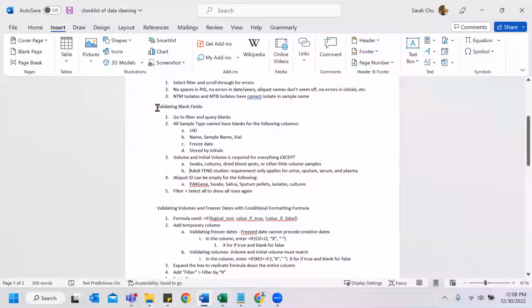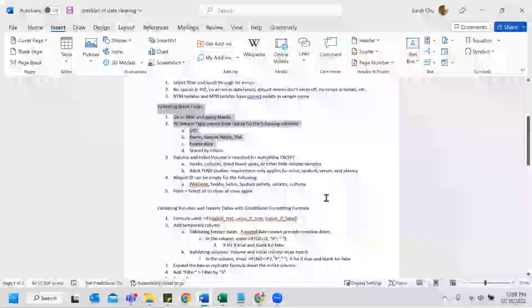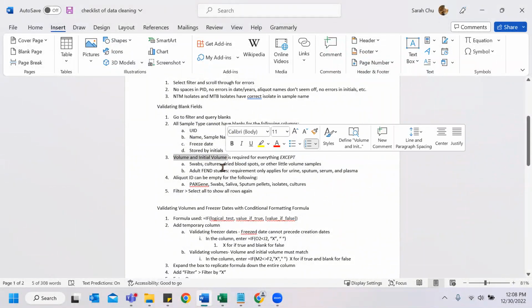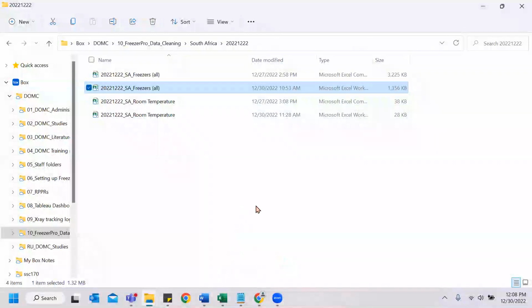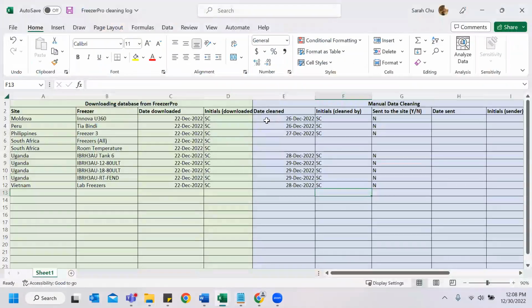So yeah, this basically has the information as well as what to look for, what fields should be filled out depending on the studies. And once you're done making the comments, always remember to save and remove those extra filters. And yeah, make sure to put in the cleaning log the date you cleaned it, finished cleaning, your initials, as well as did you send it to site. And that's pretty much it.